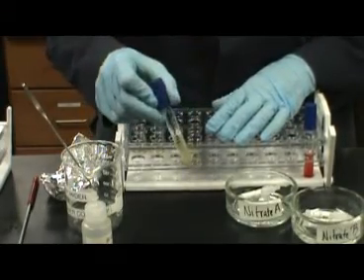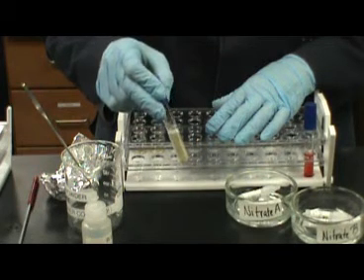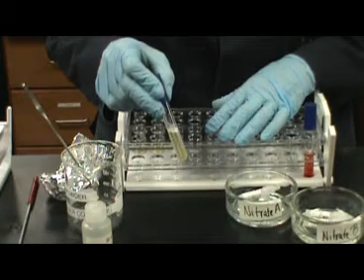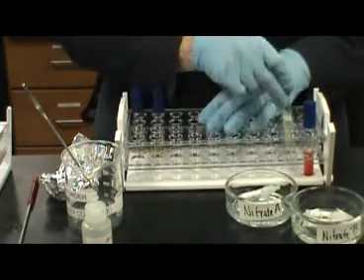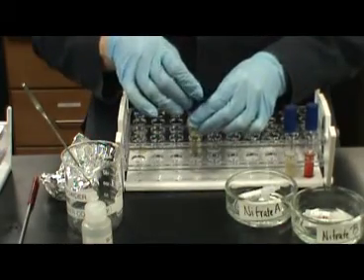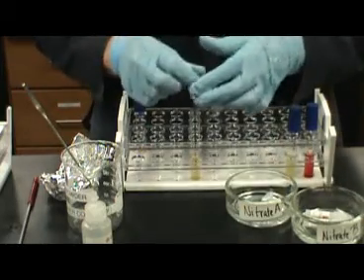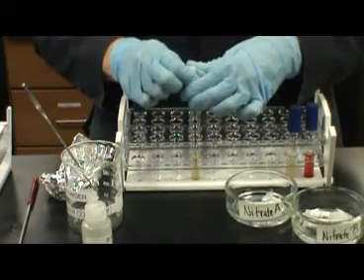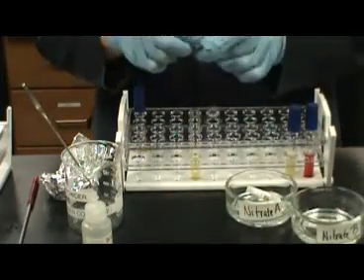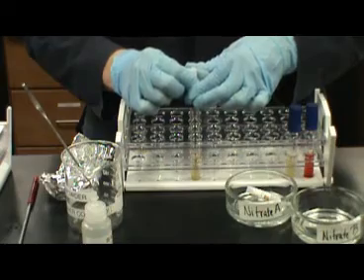Carefully swirl the tube to mix the contents. Allow them to sit for up to 2 minutes to see if a color change occurs. If the reagents turn red, this means that hydrochloric acid and zinc catalyzed the breakdown of nitrates present in the media. This means that no enzymes were produced by the bacteria, so this test would then be negative. So red, with the addition of zinc powder and hydrochloric acid, is negative for nitrate reduction.